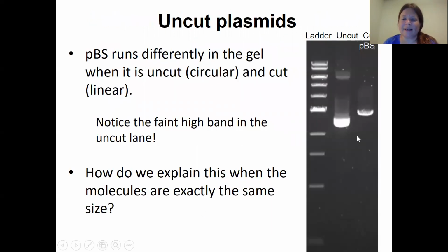And the fact that the plasmid is normally supercoiled, and only becomes the relaxed, nicked circle if it's taken a little bit of chemical damage, which the cell can fix, this sort of thing happens all the time. But that's why we see the difference in brightness there. So again, it's a scenario where you've got a high band that's really faint. But you can tell in this case that what's going on is that it's undigested plasmid, because nothing is running at the right size.